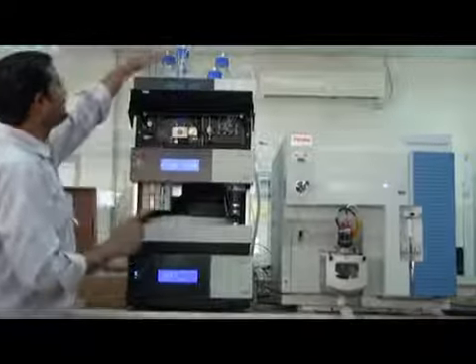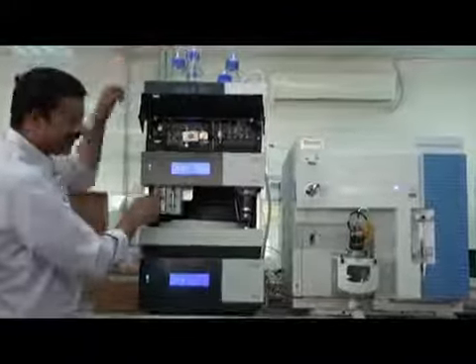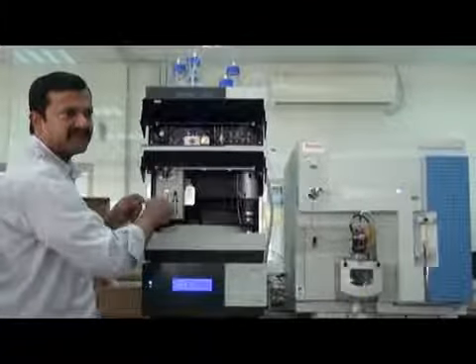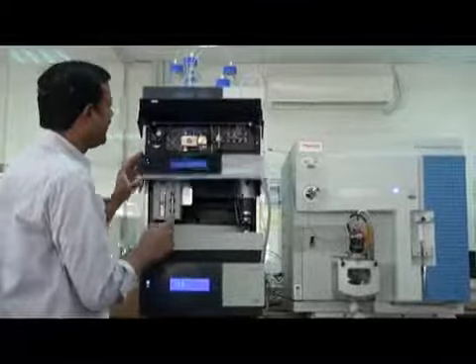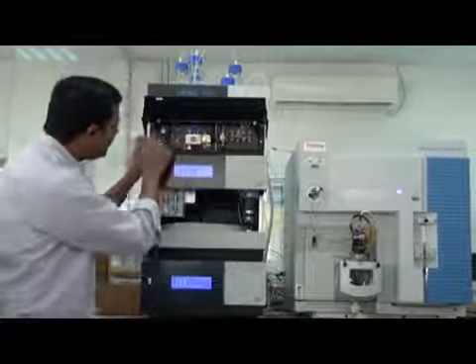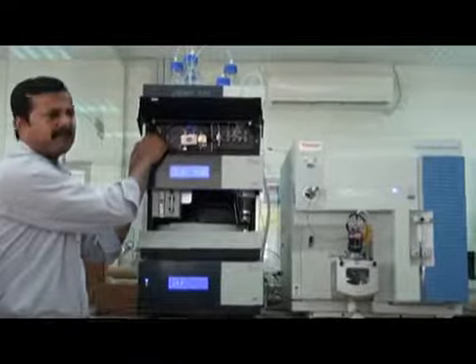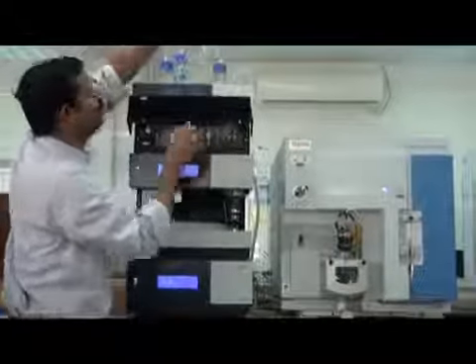Now I have explained these 4 lines. We use line B here in the syringe. We will do the priming of the syringe, then you will see. This 50-50 will be used here. Then we have a small peristaltic pump here. This is a very small peristaltic pump. This tubing comes with this small bottle.